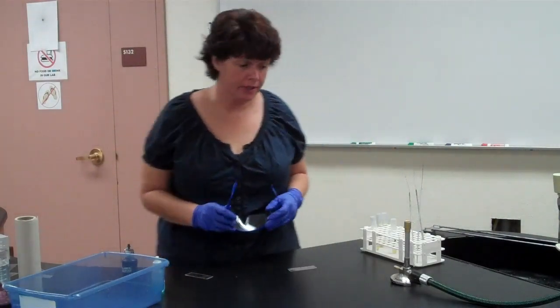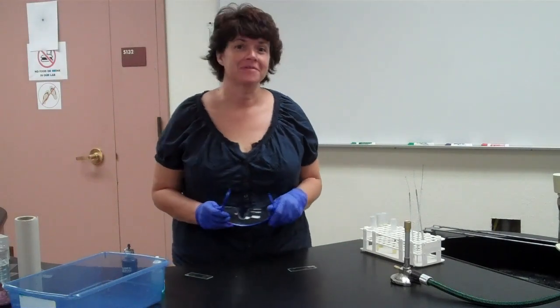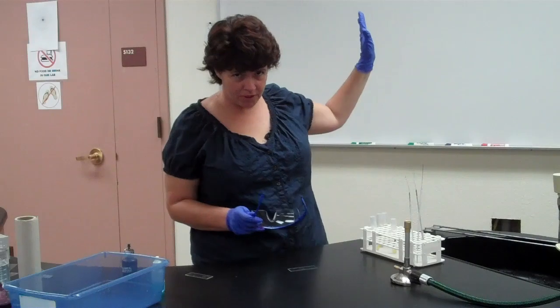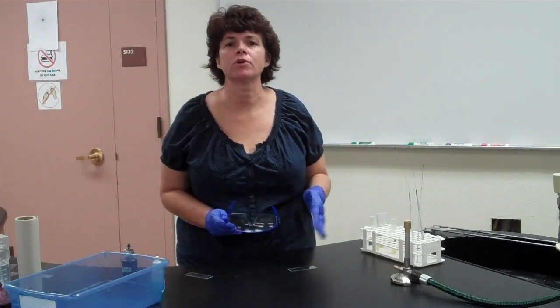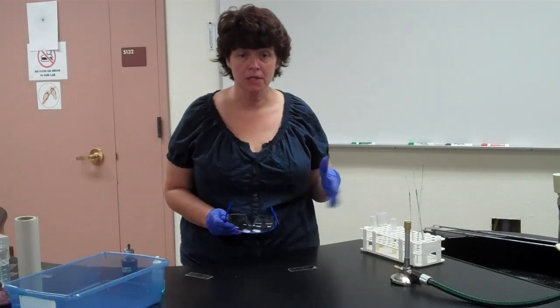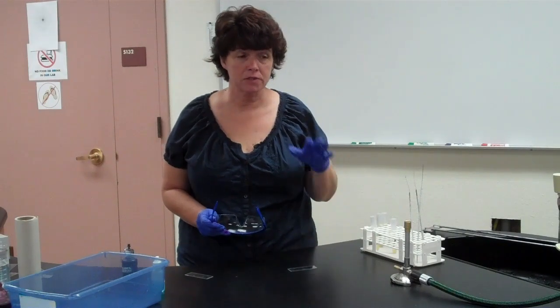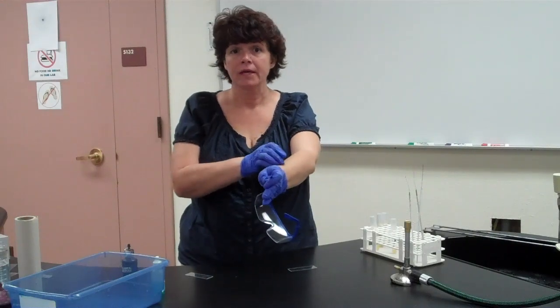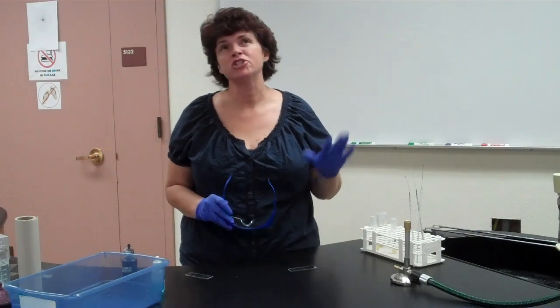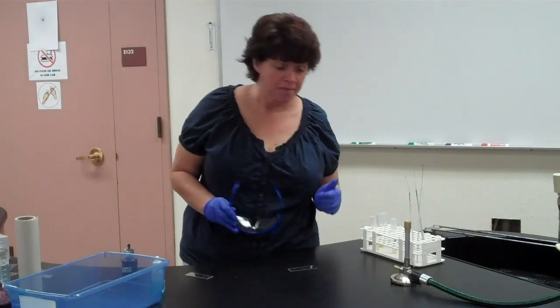This next staining procedure is called the capsule stain. It's going to be different from everything else we've done. Remember, all along I said make your smear, heat fix it, then stain it — throw that out the window. This is the first staining procedure where you do not heat fix. Same goes for the flagella stain. We're going to allow them to air dry rather than heat fix.